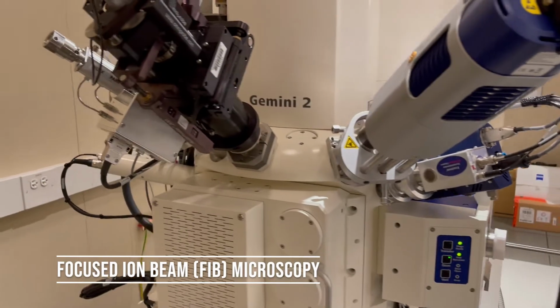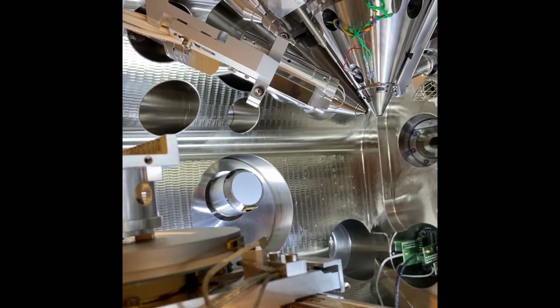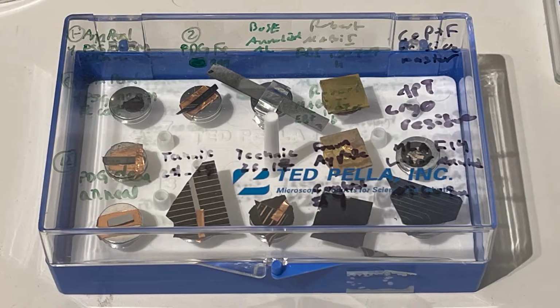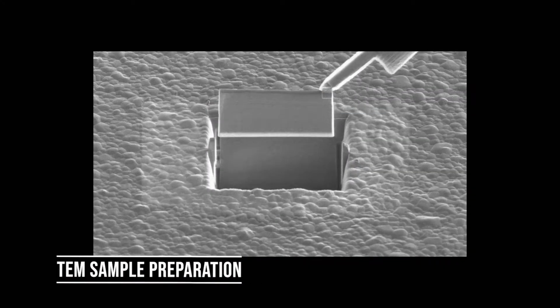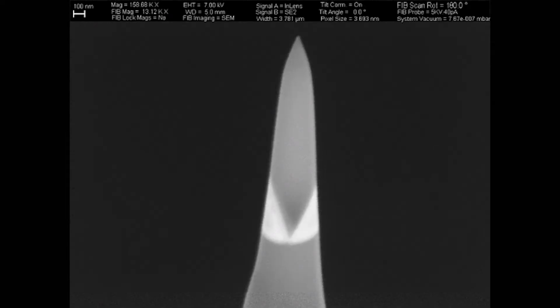Dual-beam focused ion beam instruments combine an ion source with an SEM beam, enabling the operator to manipulate the near surface and image the results. We have two focused ion beams, or FIBs. Our FIBs are primarily used for preparing specimens for transmission electron microscopy and atom probe microscopy, nanolithography, and cross-sectioning.